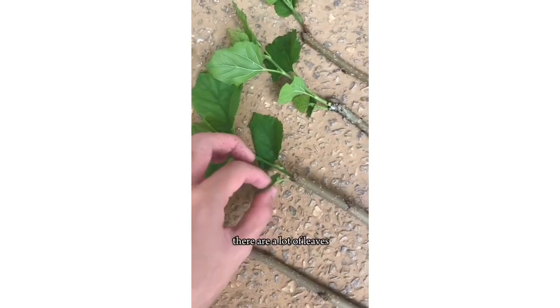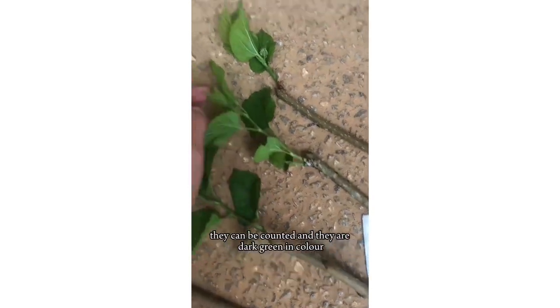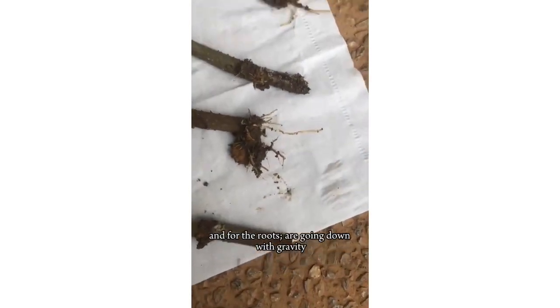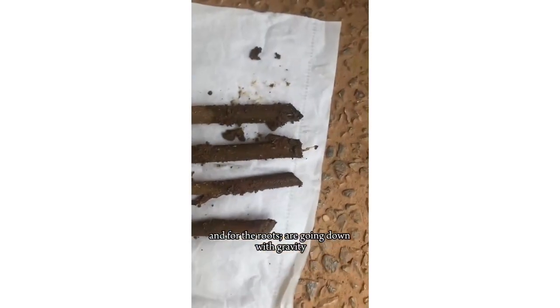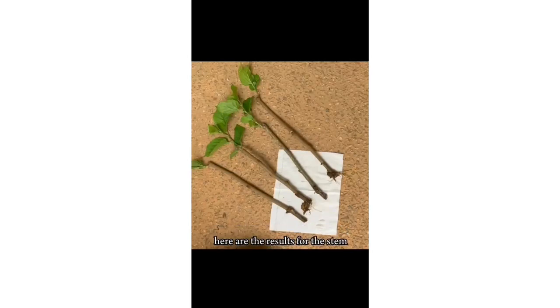As we can see, there are a lot of leaves that can be counted, and they are dark green in color, which means they are healthy. And the roots are going down with gravity, and the stems without auxin have less in comparison. Here are the results for the stems that were applied with auxin. As you can see, there is clear root growth and leaf growth. This is because auxin promotes cell elongation.